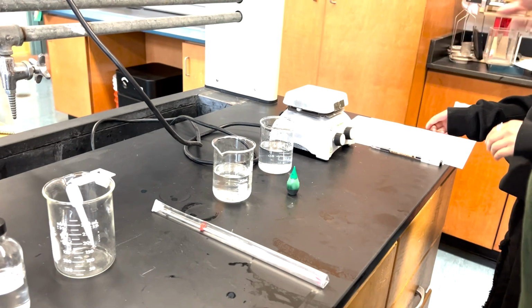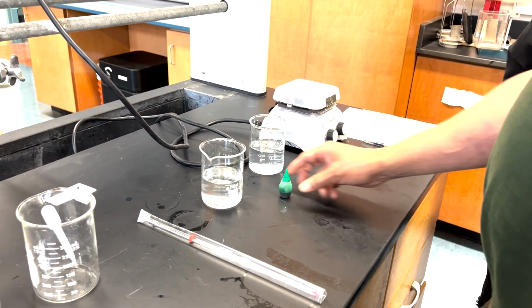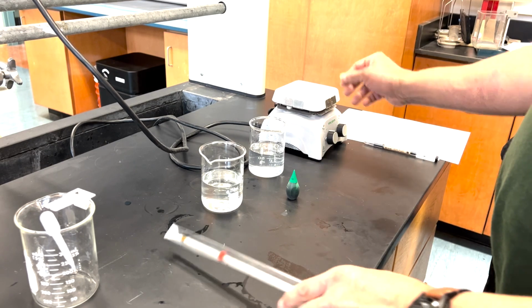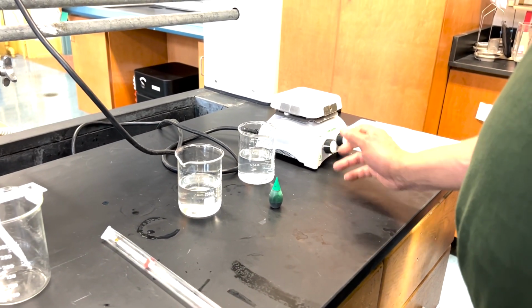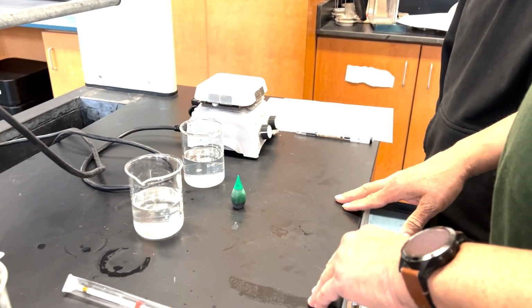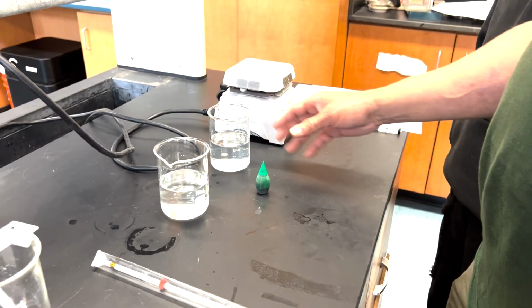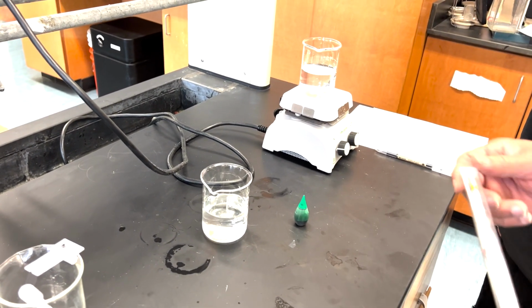Okay, first, part 3 for the osmosis lab deals with using 2 beakers, food coloring, your thermometer, and your hot plate. You want to turn the hot plate on. You can turn it high. Be a little careful. You're going to take one of the beakers. They should both have about the same amount of water, so filled up right now with 150. Having it set up, I'm going to place this on the hot plate.